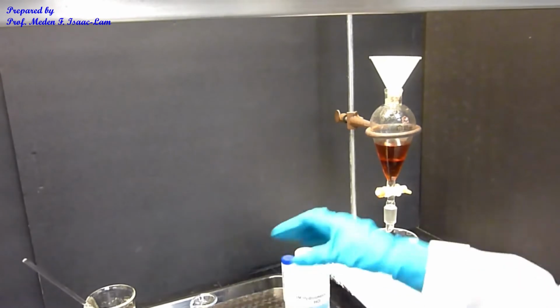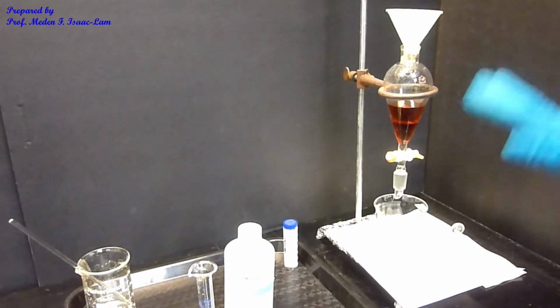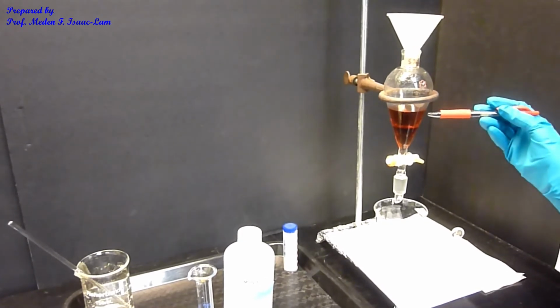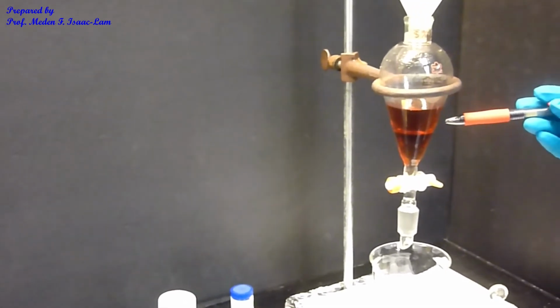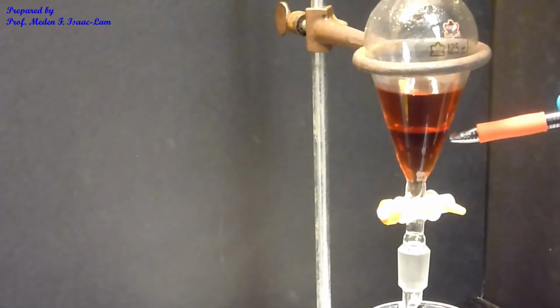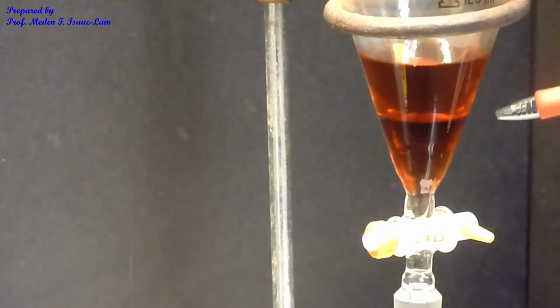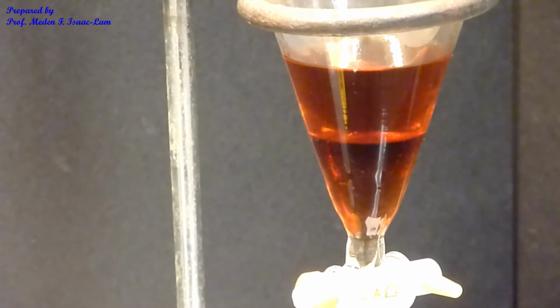Once I add that acid into my organic layer, I again form 2 layers. You can see it's dark. The upper layer contains my ether, and after I shake this, the amine should react with my acid and go down. So adding the acid will separate the amine, and the ether layer will only contain the neutral component.